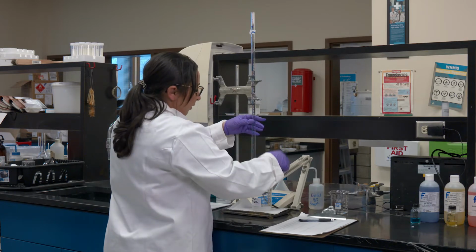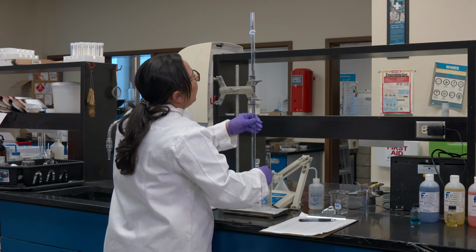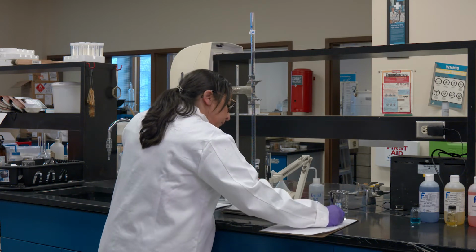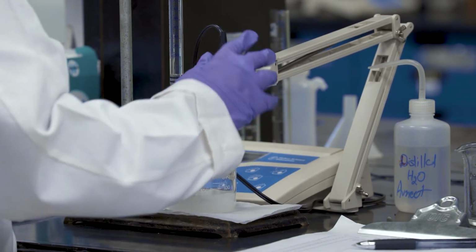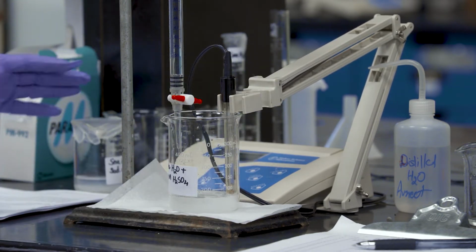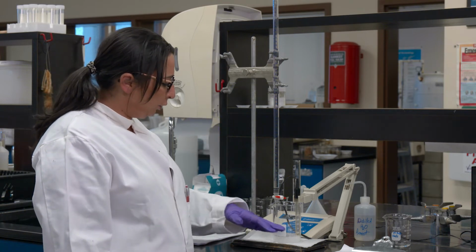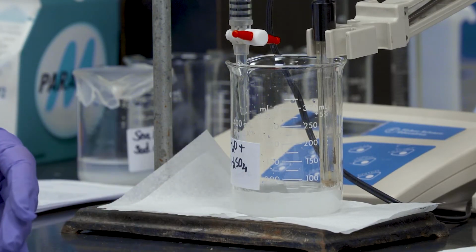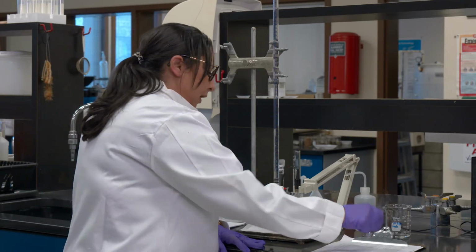Okay, I'm going to continue taking a few readings, and then I want to comment on the way the solution is going to look eventually as I keep adding more acid. Okay. I'm going to let the pH meter do its thing. As we move further into adding more acid into our solution, you will see the cloudiness, the white, it's a bit cloudy and it's a white solution because I added carbonate in it. It will start turning transparent because now the buffer capacity is going down, it's becoming more acidic. Okay, so that's something I would like you to keep noting here.